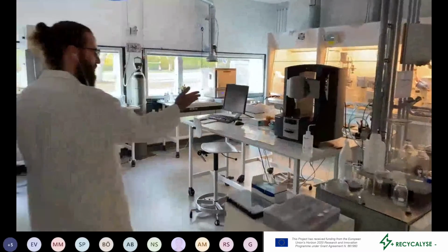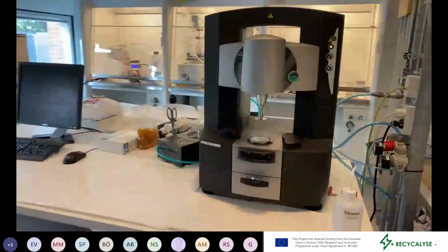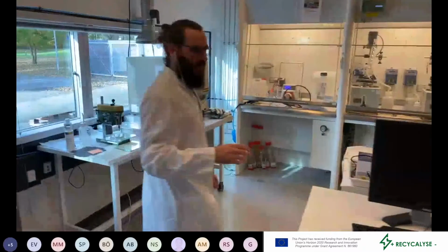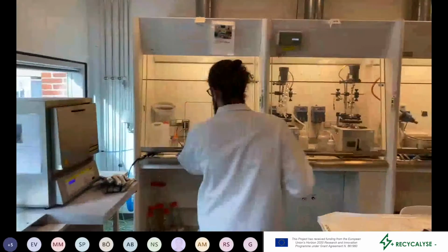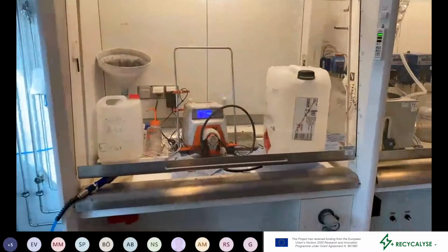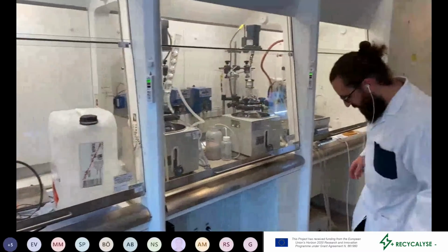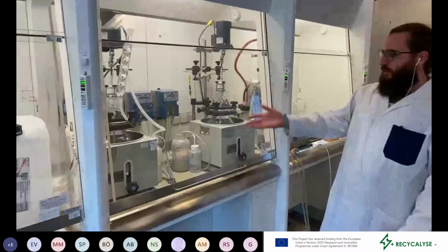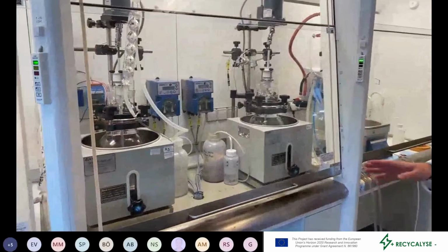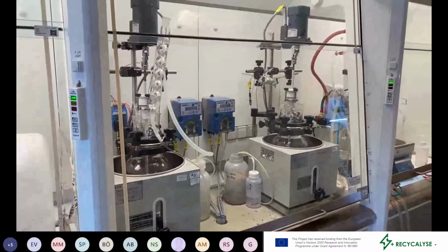Here we have our viscosimeter. It's not really used super much in this project, but it's always good to have when optimizing inks and slurries and stuff like this. Here we have our filtration system, which we use when we want to try to clean the products with filtration, which we saw was not really ideal for the latest synthesis. Then here we have 2 development batch reactors. Each of them is 3 liters, so they're a little bit more capacious than a standard oil bath solution.